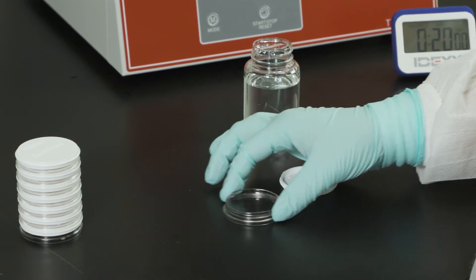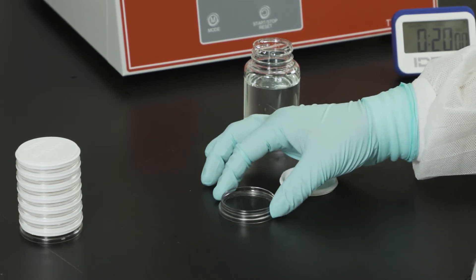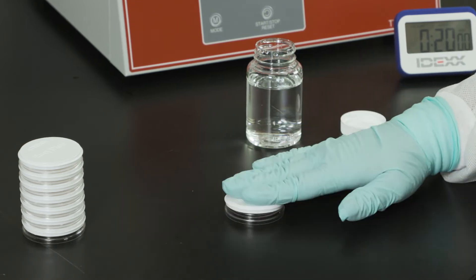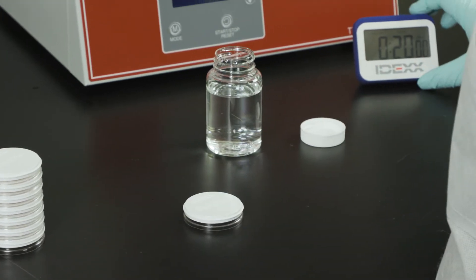Gently swirl to coat the entire plate and replace the lid. Incubate undisturbed at room temperature for at least 20 minutes, allowing the media to set.